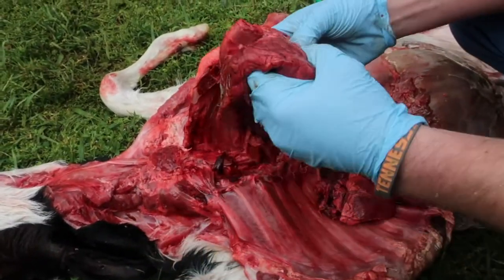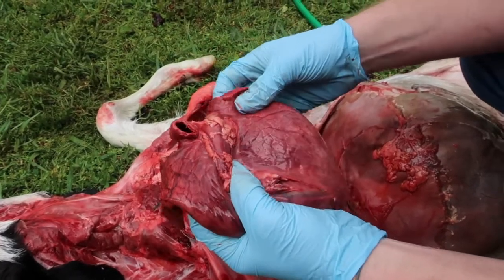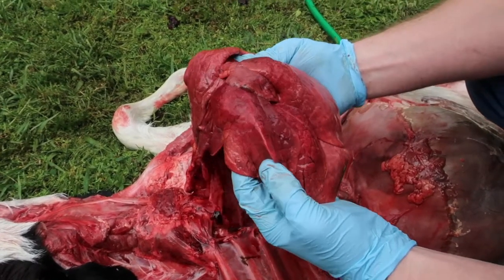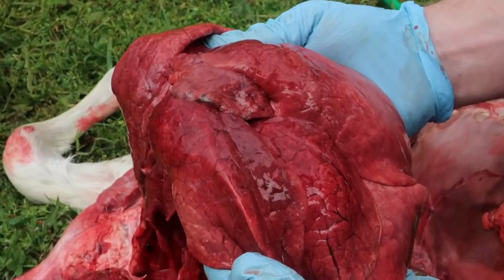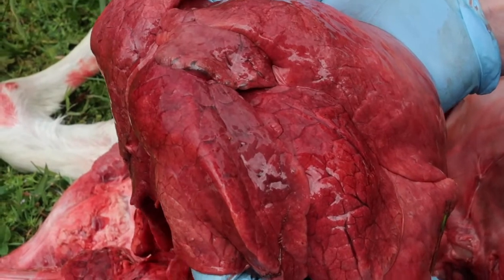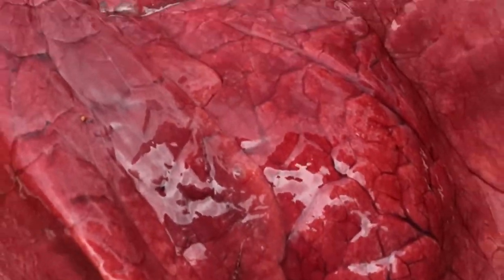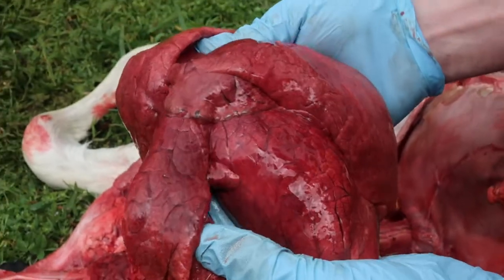So, just want to show you a little bit about the lungs. And you can see these different lobes, and I kind of showed you earlier. But inside these lobes are very small hollow structures called alveoli. And these hollow areas are where oxygen can enter into the lungs, and there can be exchange of oxygen and carbon dioxide between those alveoli, and so the red blood cells can receive oxygen there and exchange that with CO2.